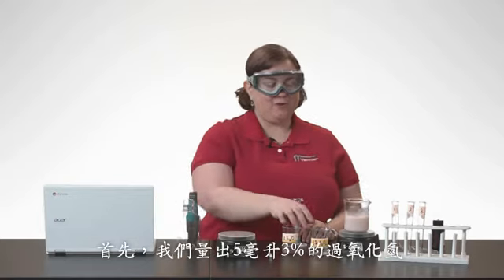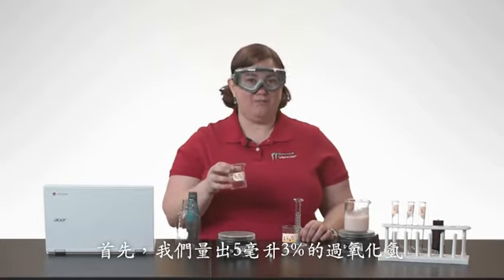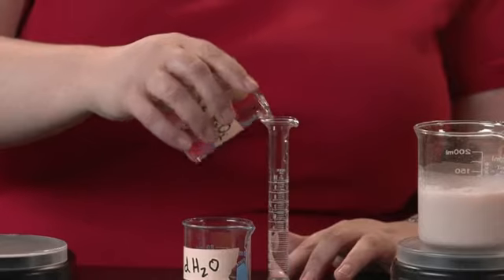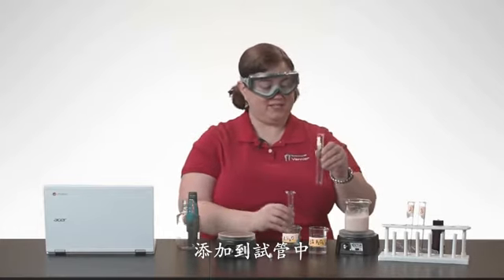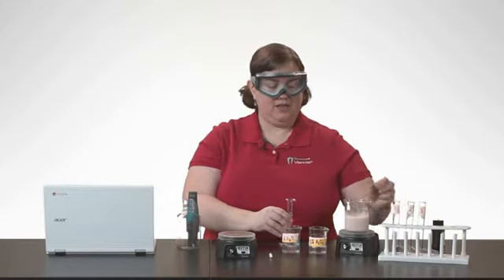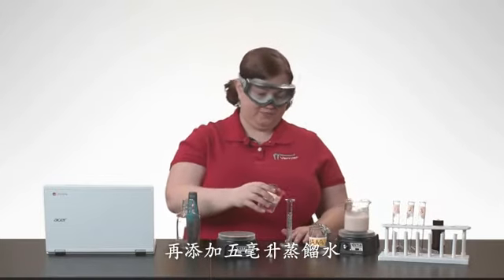First, we're going to use our 3% hydrogen peroxide and measure out 5 milliliters. Then we're going to add that to a test tube. And then we're going to add 5 milliliters of distilled water.